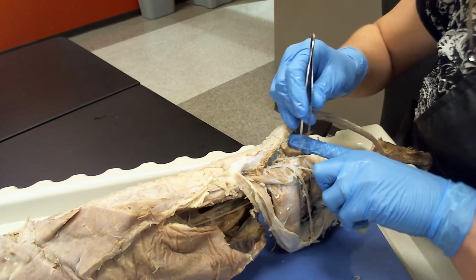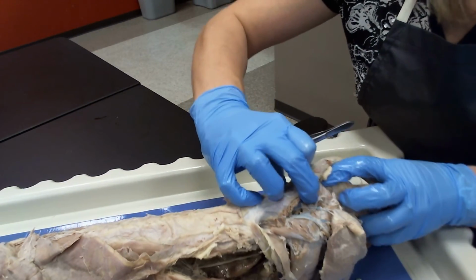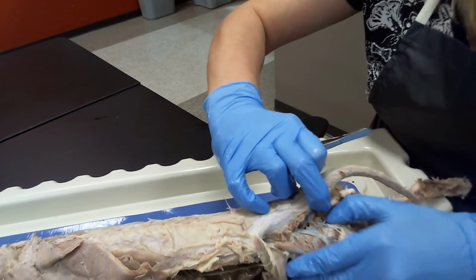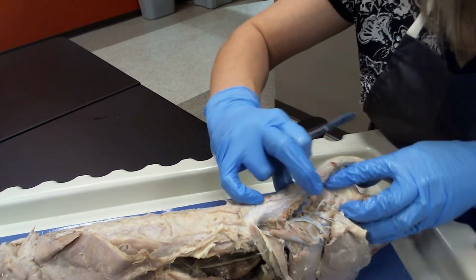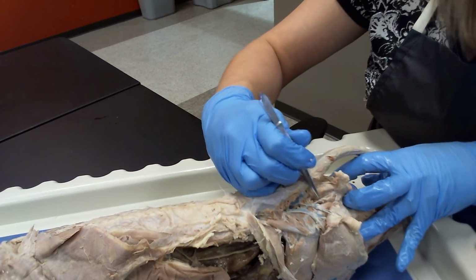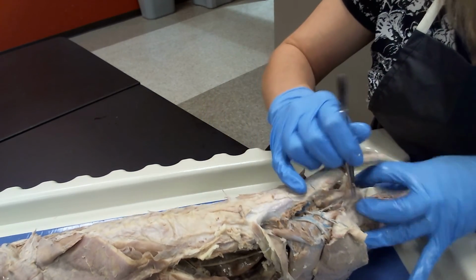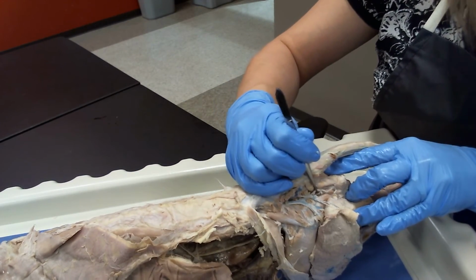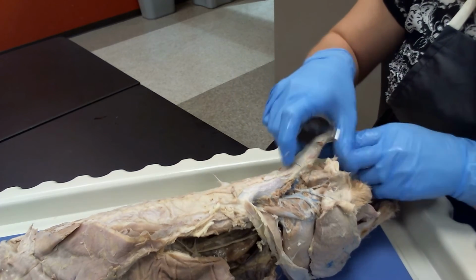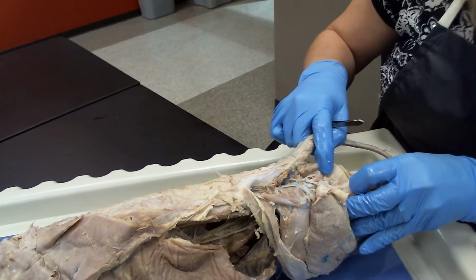That's right there. Okay. So now if we continue to turn our cat kind of to the side and we pull the tail over and we're diving and we're literally looking in between the two wings of the pelvis, what you can appreciate right here is going to be your pudendal nerve. Your pudendal nerve runs down to the anus, okay? So you've got your pudendal nerve right there. That's an extremely important, medically extremely important nerve to know.